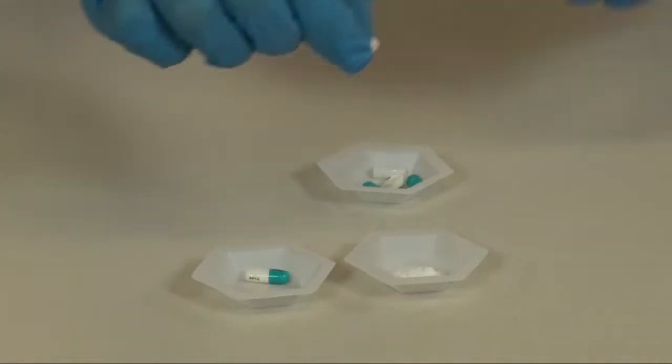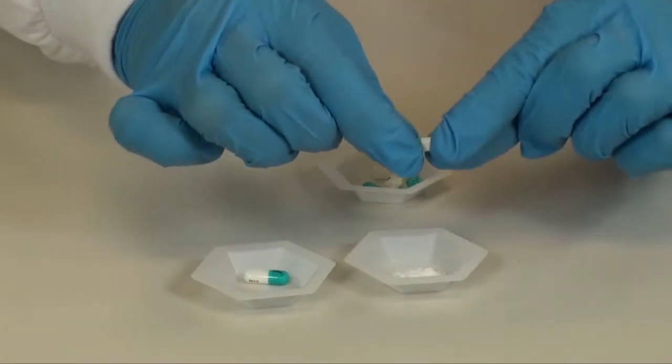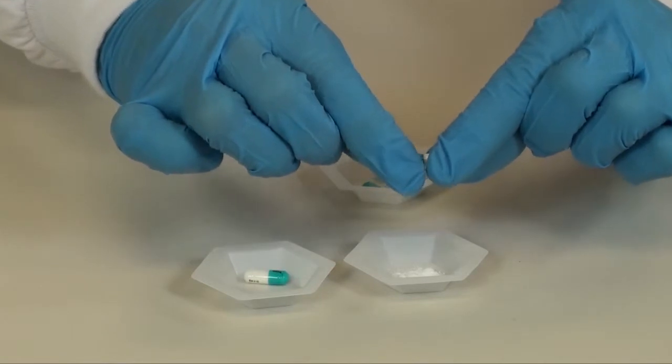Open the required number of hydrochlorothiazide capsules and empty the powder into a small weigh boat.